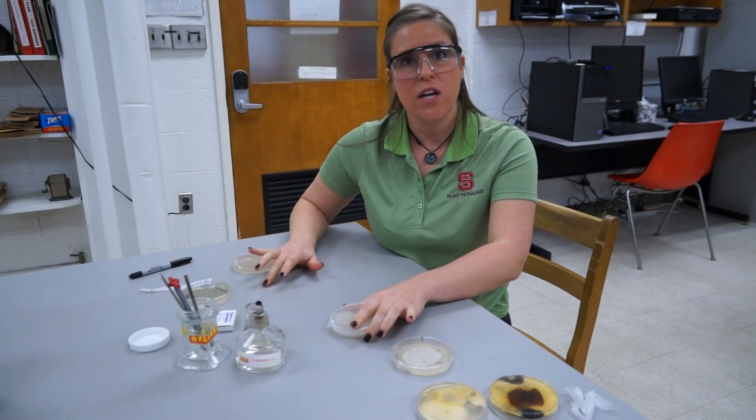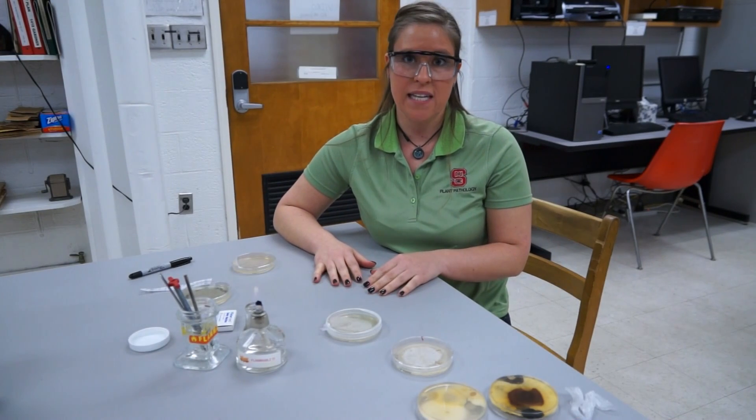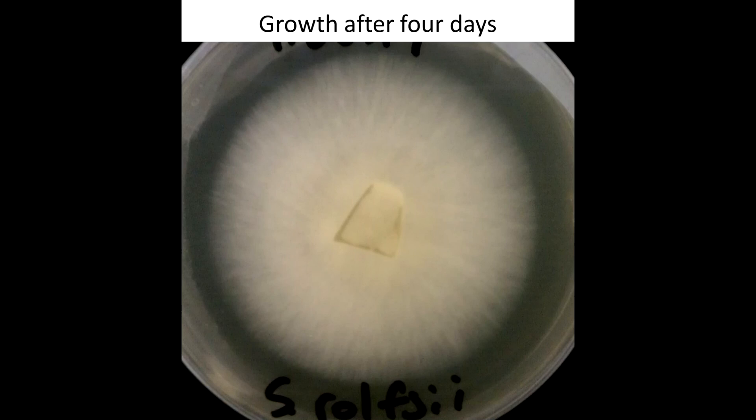So that's a little bit about aseptic technique — keep it pure. Let me know what it looks like.